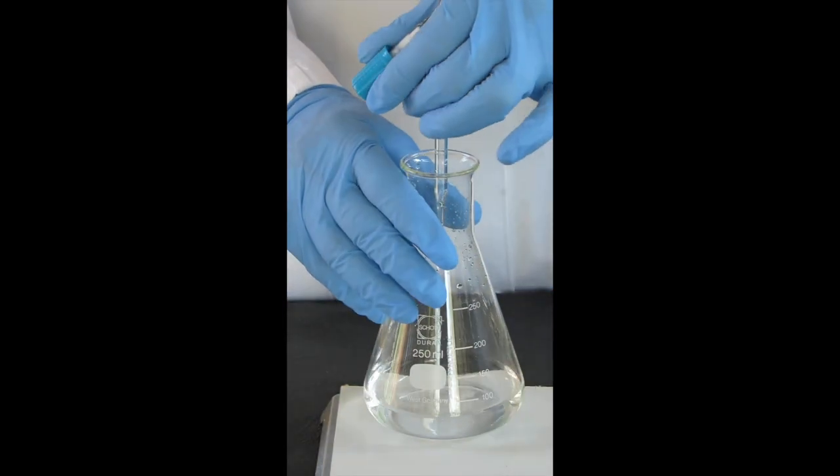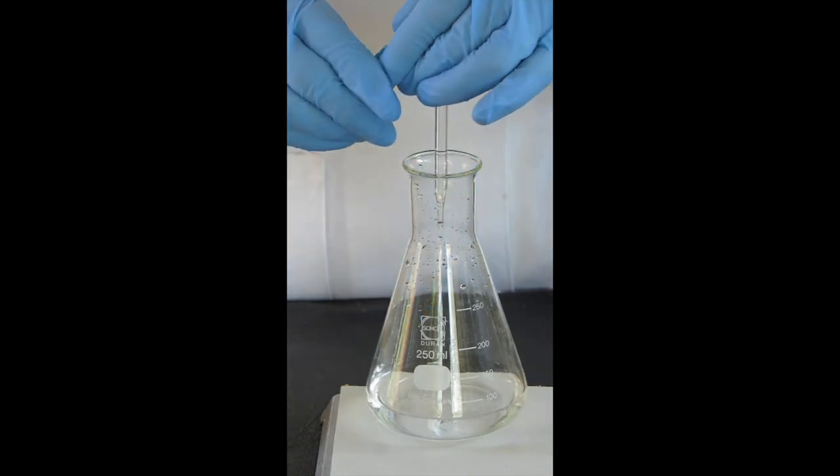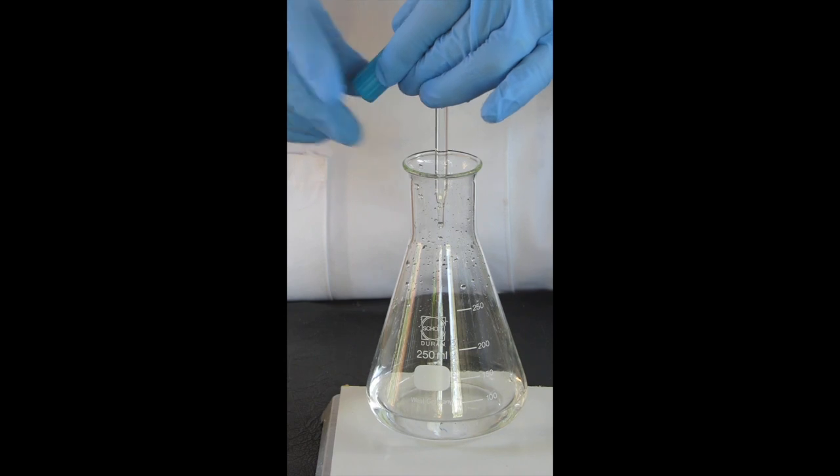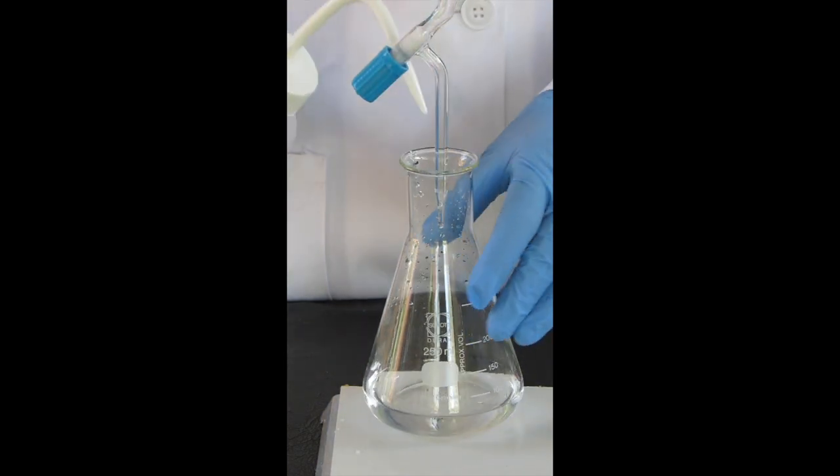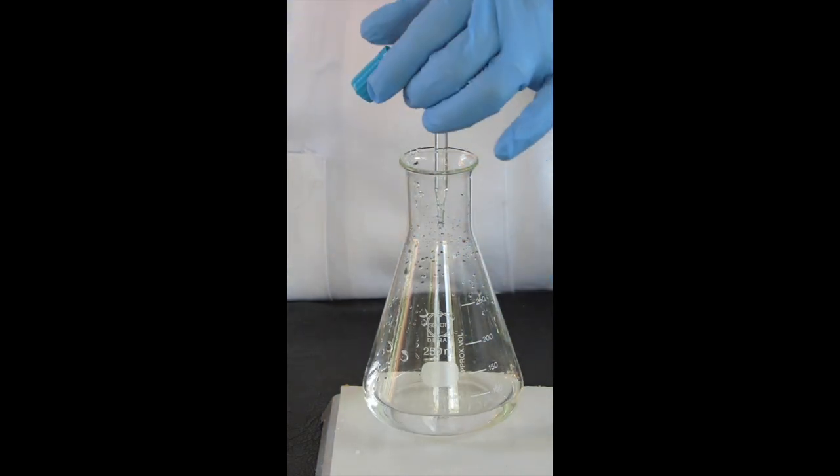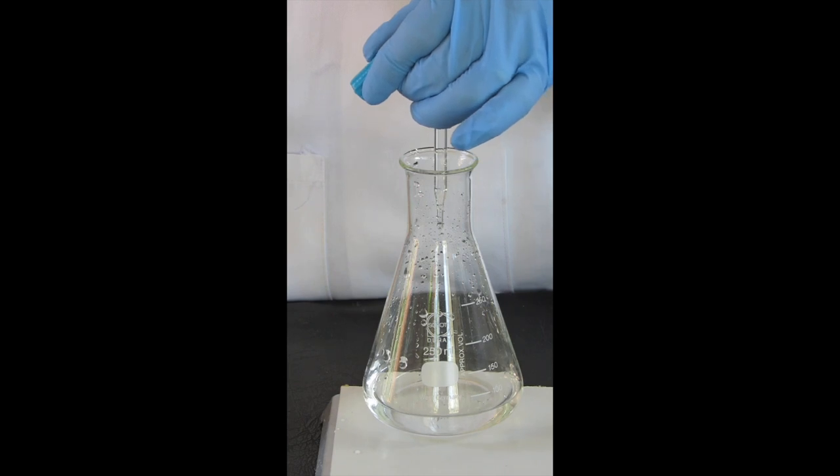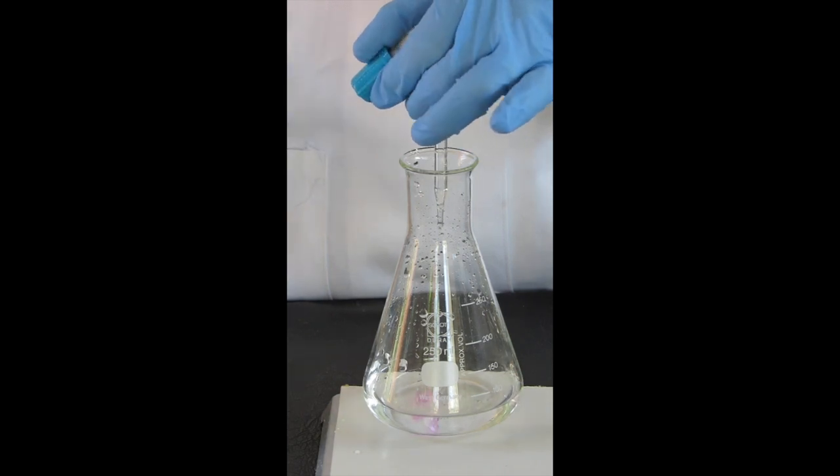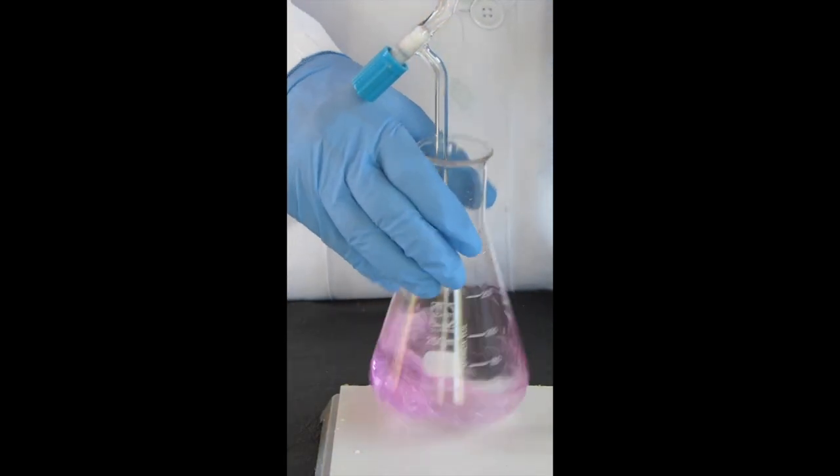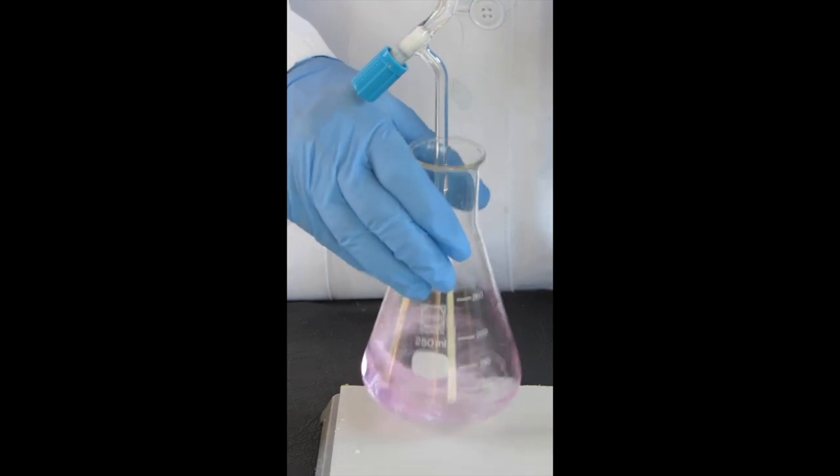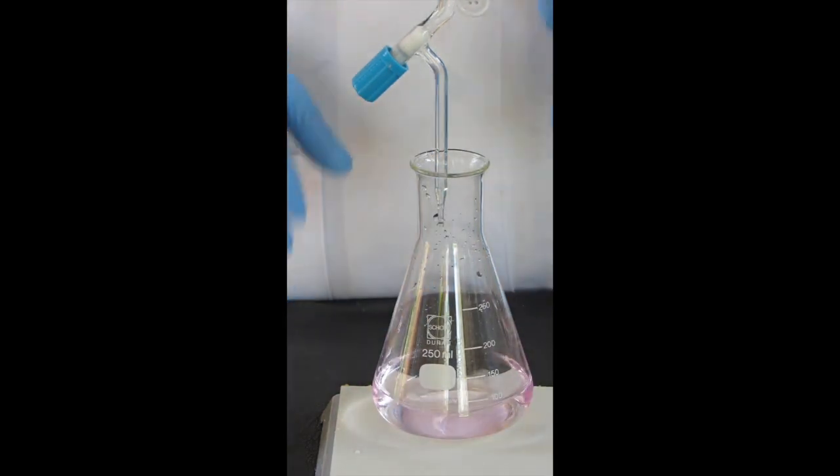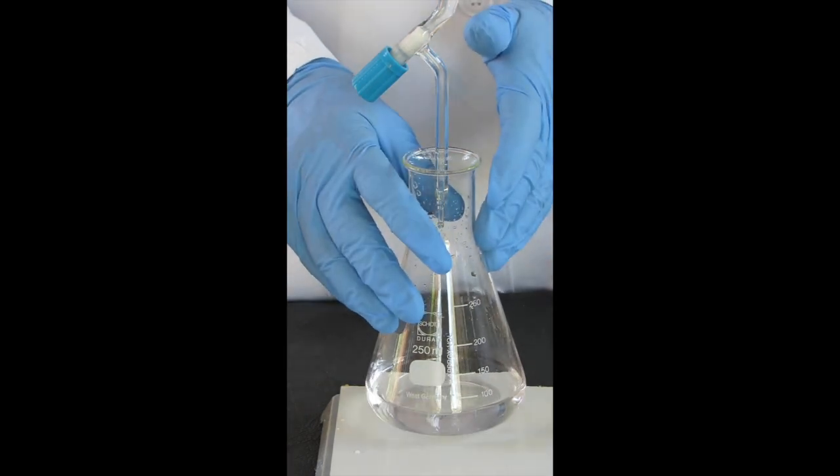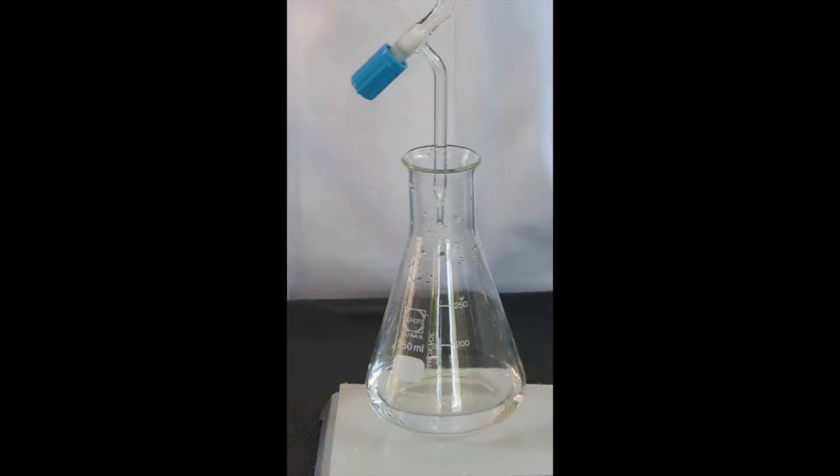That has faded—needs to last a little bit longer than that. Now at this stage we can get a tiny drop to hang on the tip of the burette and wash that in. A little bit more... and there you have a good endpoint. I think I've reached the endpoint.